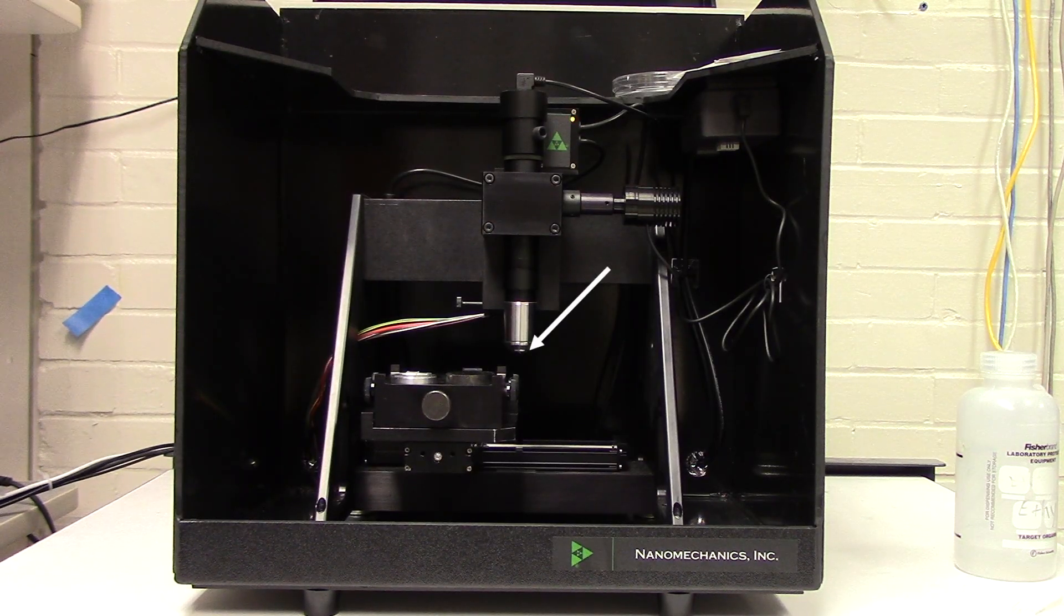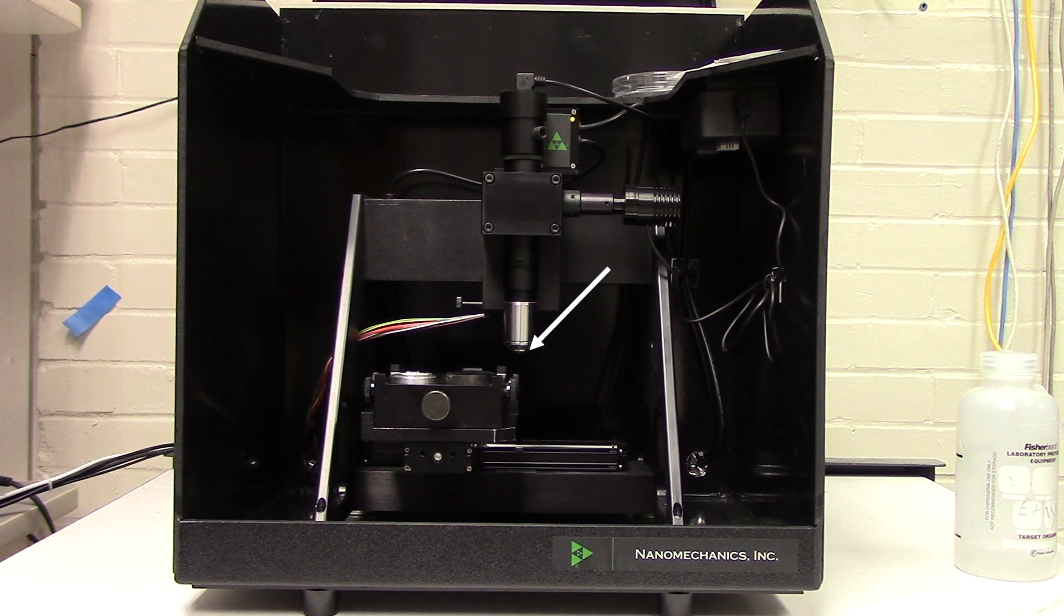Here, we have the InForce 50 actuator with a Berkovich tip, which allows for us to take measurements on the Nano Indenter.